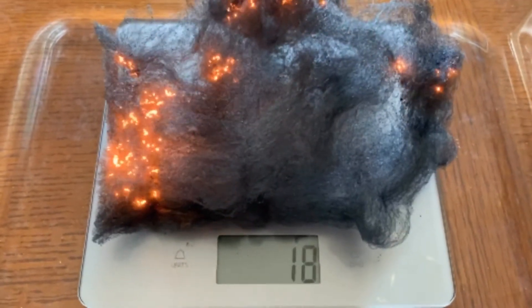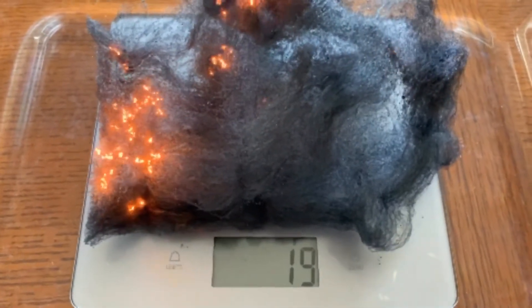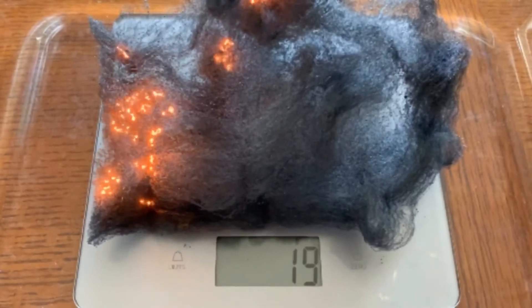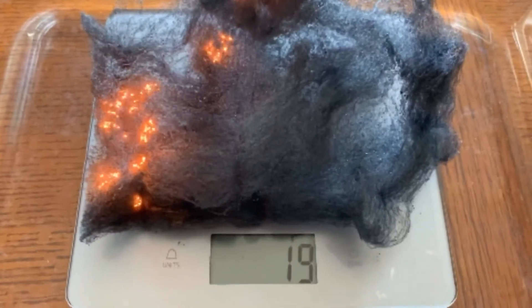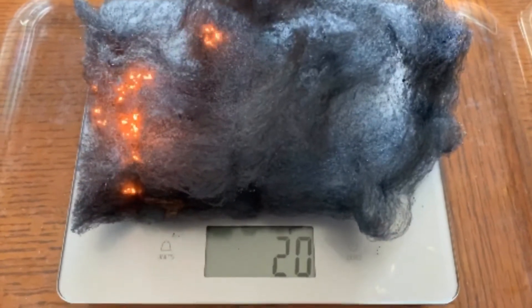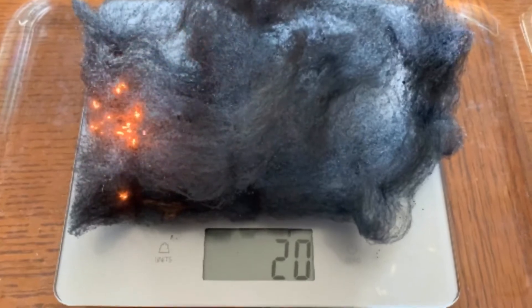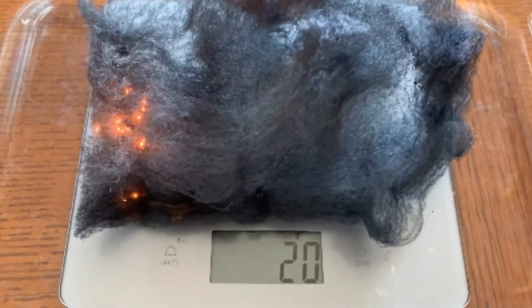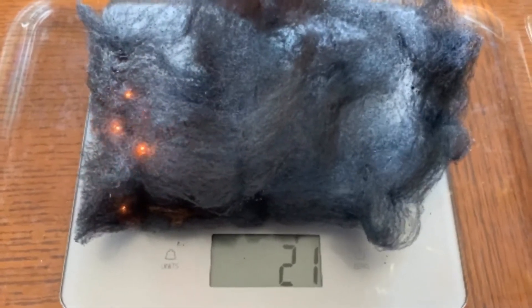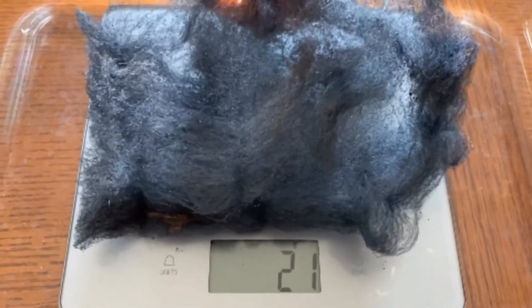Starting at 11 grams, all the way up to 20 grams now. 21 grams. Wow.